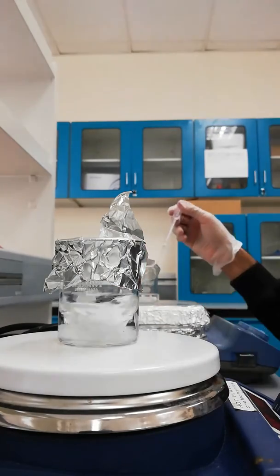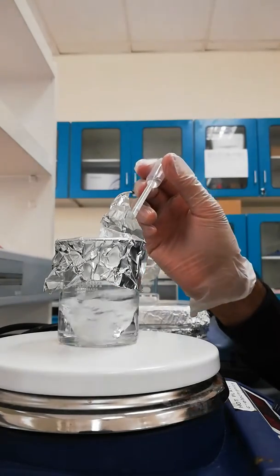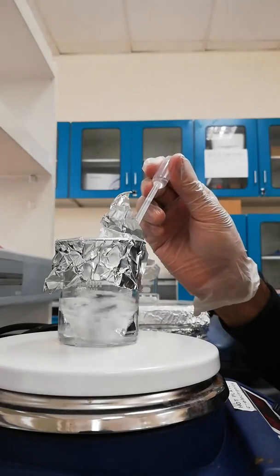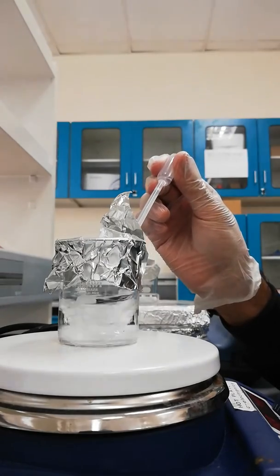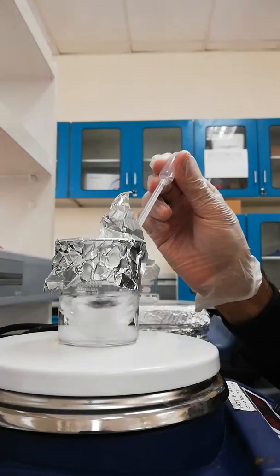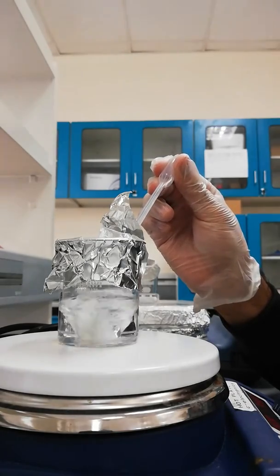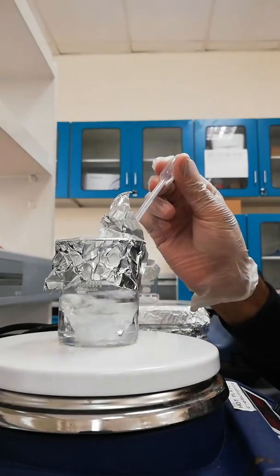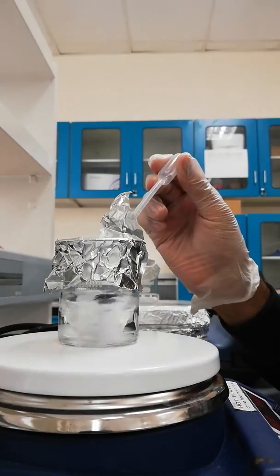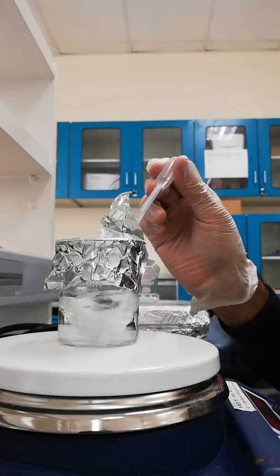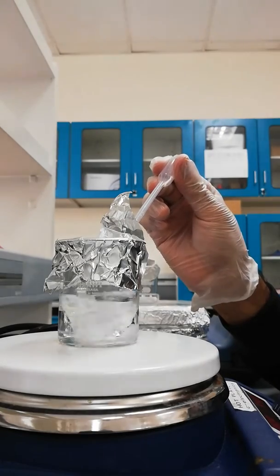Before adding sodium hydroxide into zinc acetate solution, I have heated up sodium hydroxide also at 60 degrees so that there should not be a temperature change. Let's see how it goes.